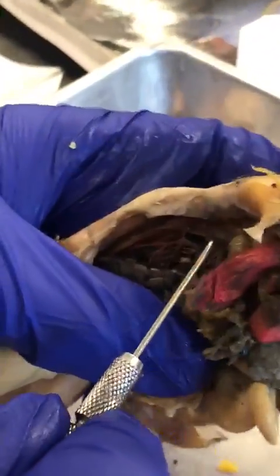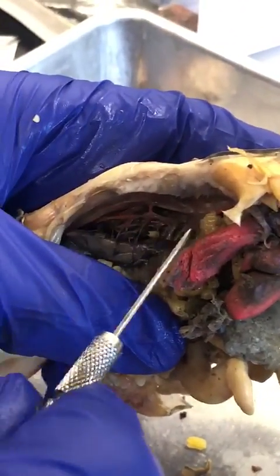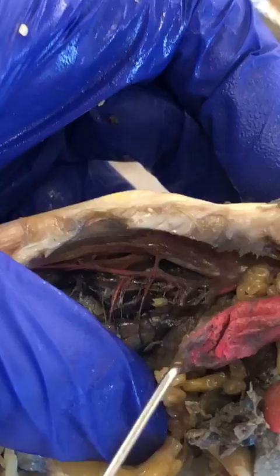And then this is the rest of the dorsal aorta. It's so hard to see. Yeah, no, you're good. That's the rest of the dorsal aorta back there. The dorsal aorta eventually goes to the bottom where it splits into the, what was it, the common iliac? The iliac arteries. Yeah, the iliac arteries. I just had a good view of them earlier.